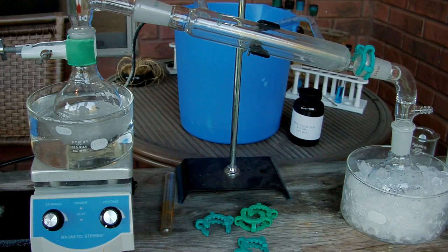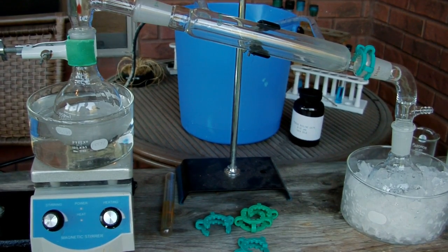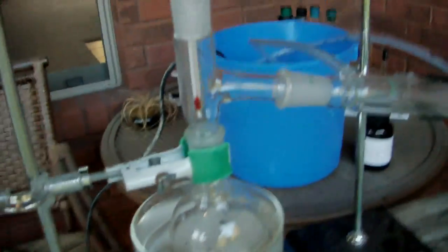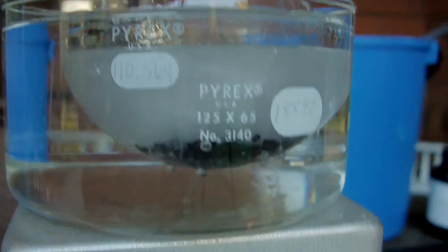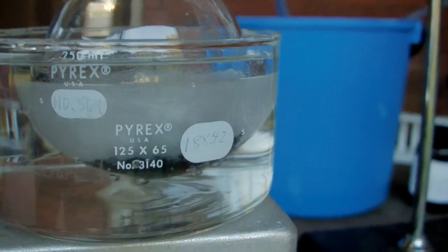And this stuff is extremely viscous, really nasty, just a goop. That's what the petroleum distillates have done to it. It's thickened so that it's easy to spread on the surface that you're stripping. You can see in here it's just this nasty kind of gray material.